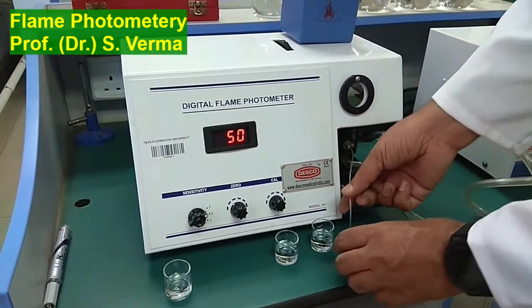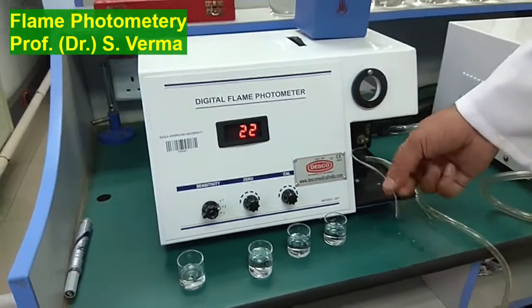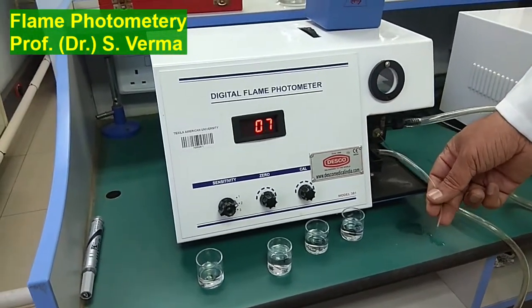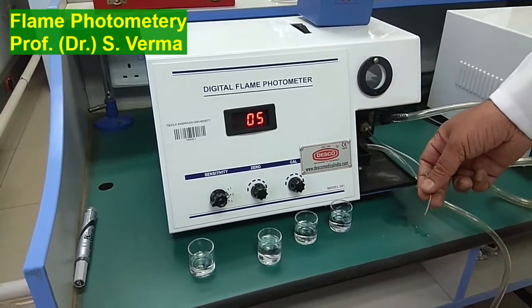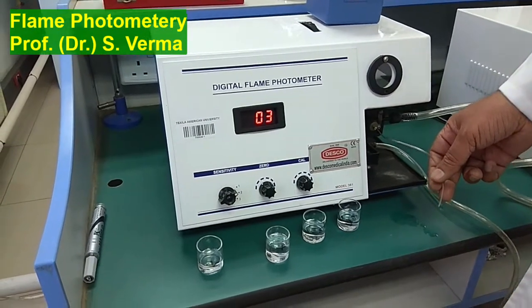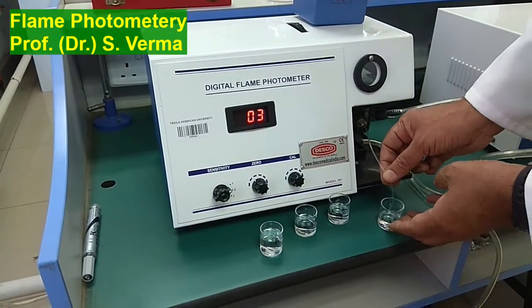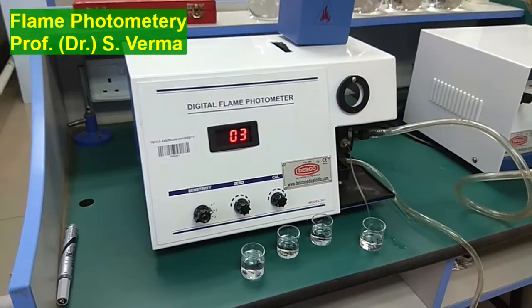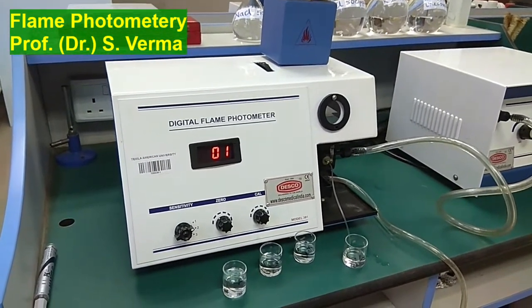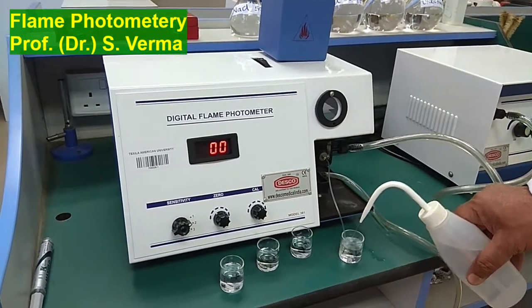I'm taking the capillary out and will put it back in distilled water, but I'm waiting for a while so that whatever solution is there in the track goes into the flame. I'm not disturbing our requirement. I forgot to show you the color of potassium ion. Basically the flame color changes to purple when there is potassium. So with distilled water, I can see the display is already at 0.